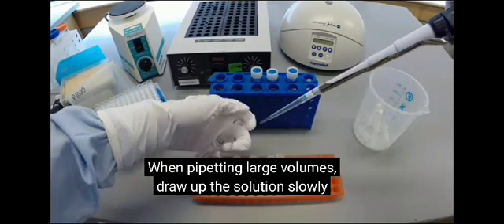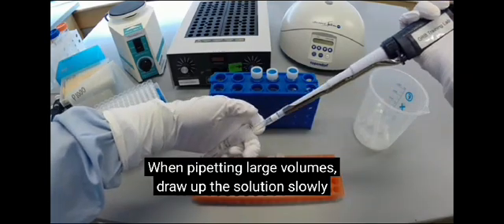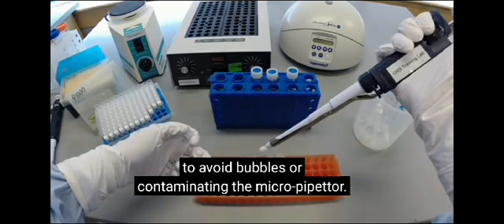When pipetting large volumes, draw up the solution slowly to avoid bubbles or contaminating the micropipetter.